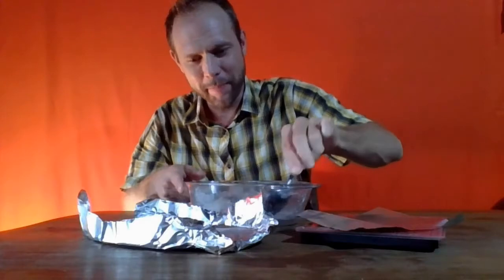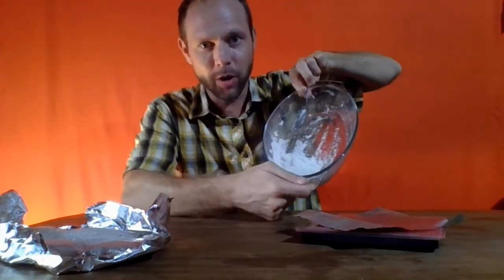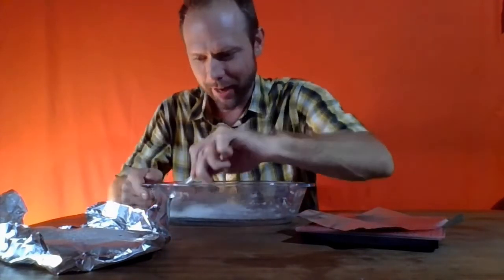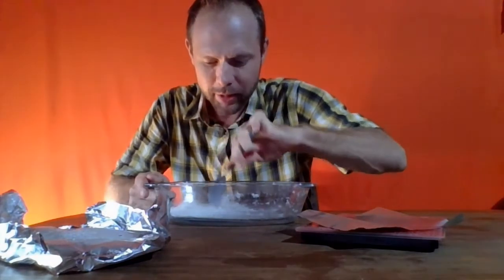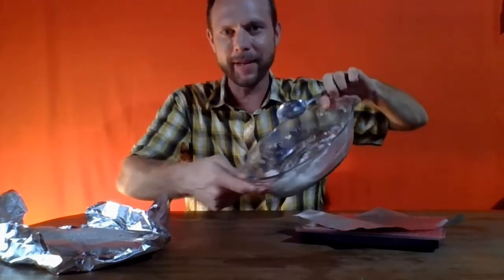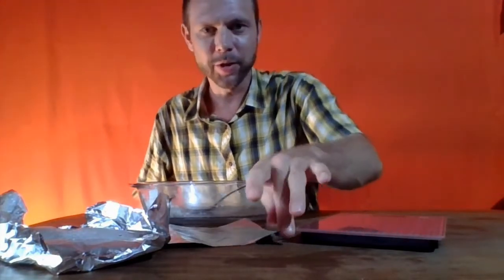Okay, now I'm scraping here. I've taken off the lid and I'm scraping to recover the salt. If you recall, the empty container with the lid was 938 grams. We ended up with 958 grams with the salt. So by difference, we should have 20 grams worth of salt. So let's scrape it down here and take a final weight, see if we've really been able to recover anything. And I'm going to turn on the scale.